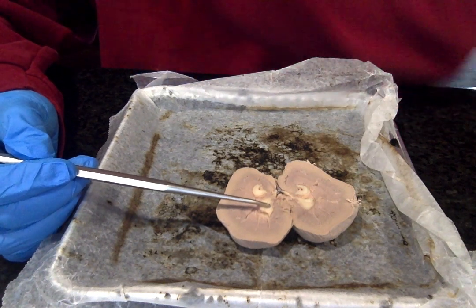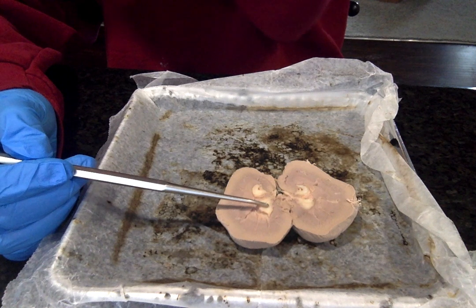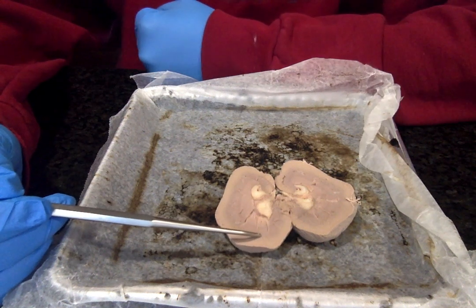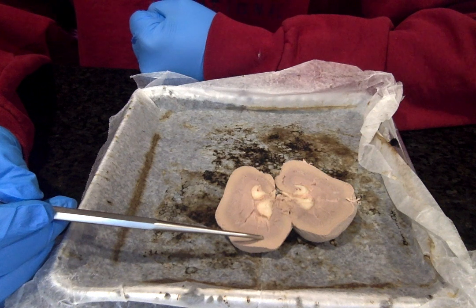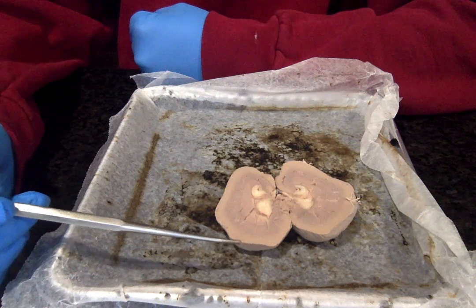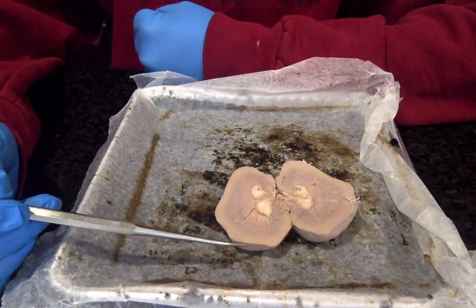The renal corpuscles are found out in this outermost region. This is where the glomerulus is enclosed with a capsule, and it's the site of filtration. We have the renal capsule, which is just the outer protection of the kidney. It is composed of dense, irregular connective tissue that protects the kidney and helps it maintain its bean shape.